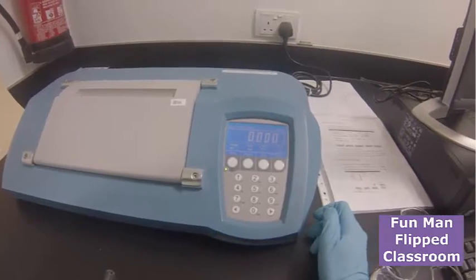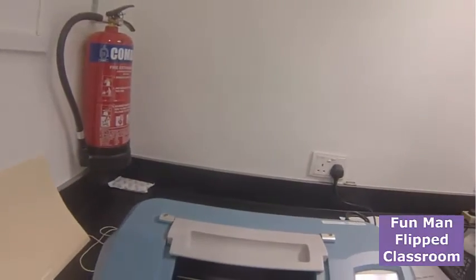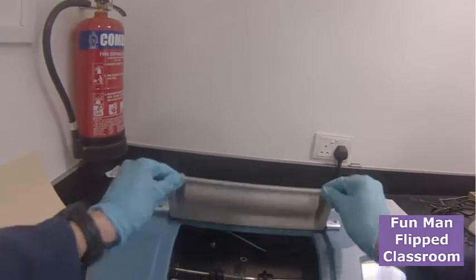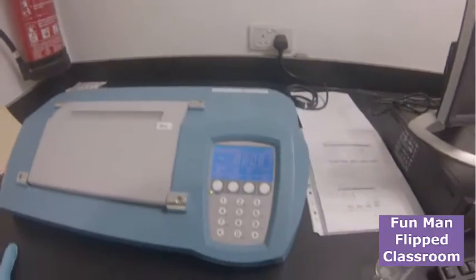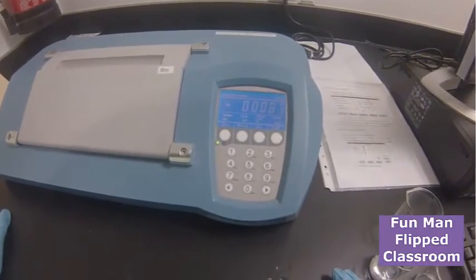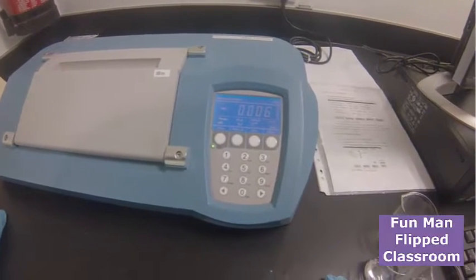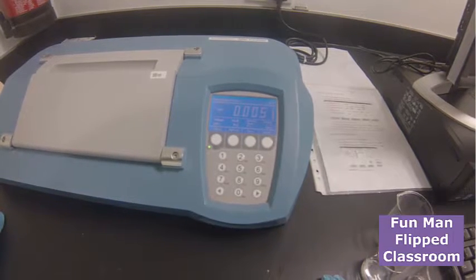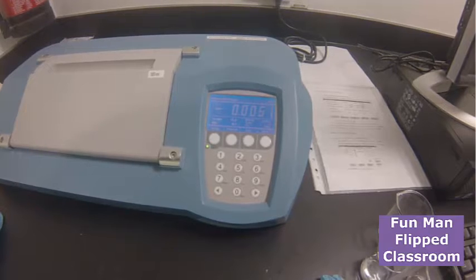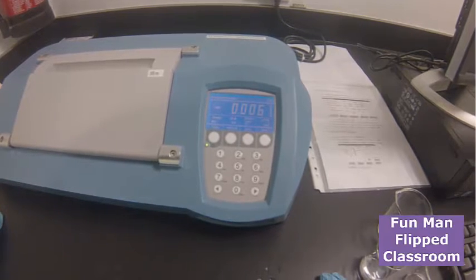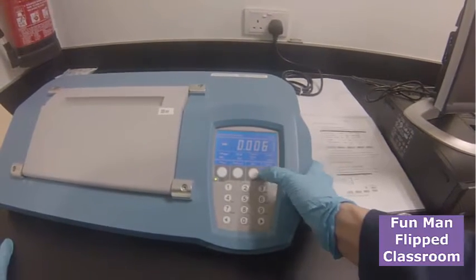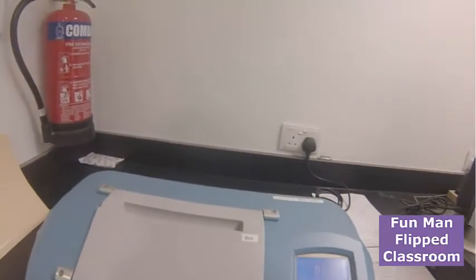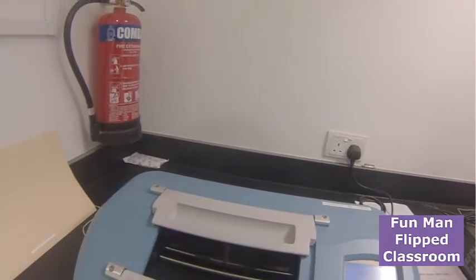I put zero to make it completely zero. Now we try again without any solvent. Place it inside. It should show zero. See, now it does, so it should show zero. Zero.